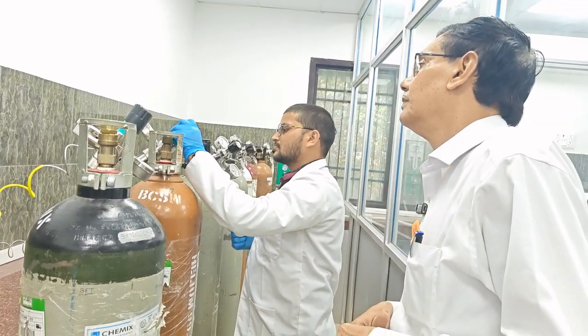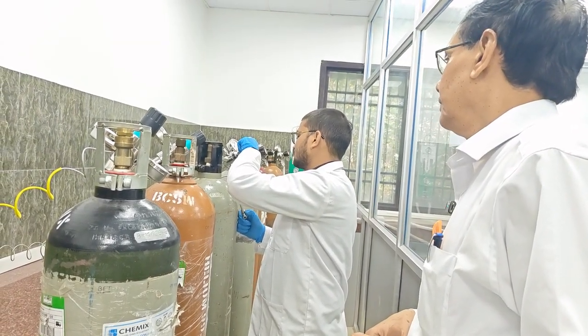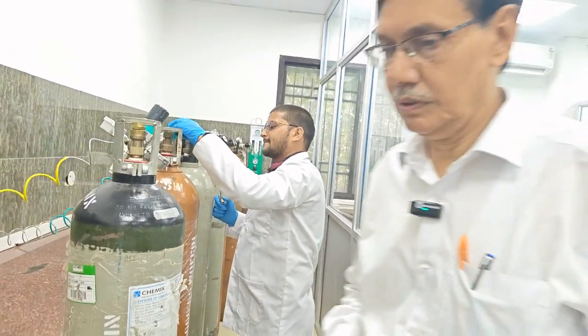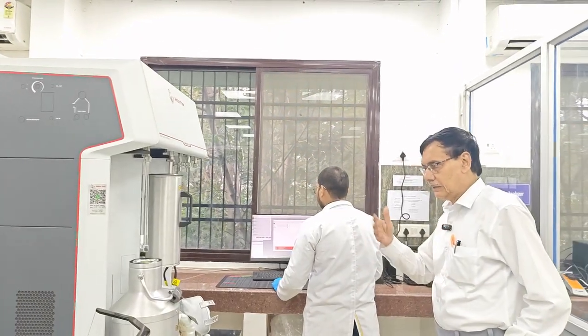Any problem? Close. You can check the thing. Just the regulator. Now we'll start the experiment.